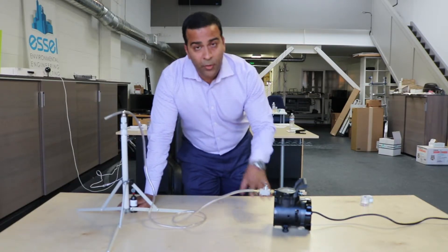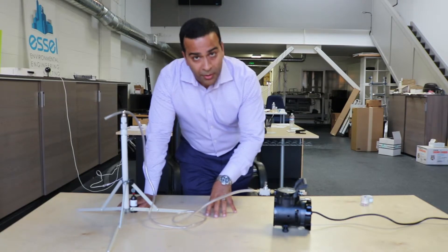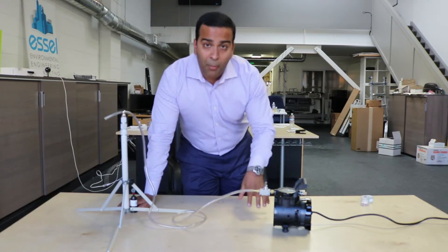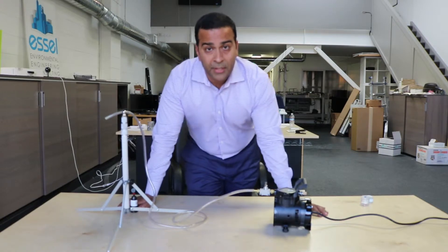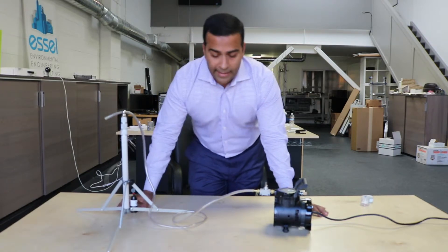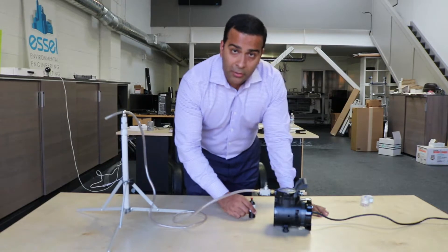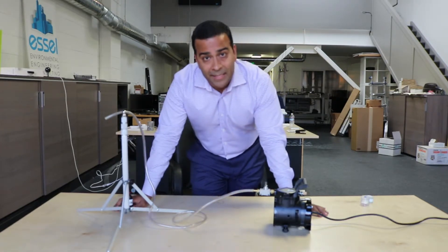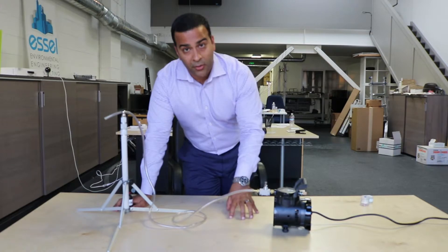With the PCM cassette, when you have it analyzed in the laboratory, they're looking for fibers or particles that fit within a certain size ratio and certain characteristics. Whether it's a dust particle or an asbestos particle, you can't tell with a PCM — so that's why it's a general exam.